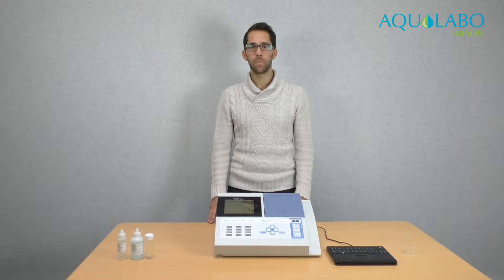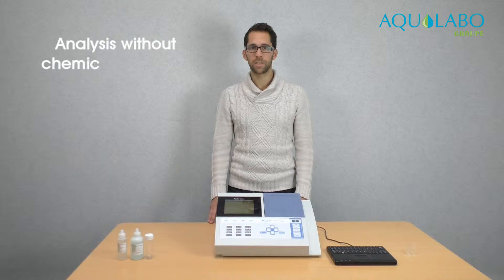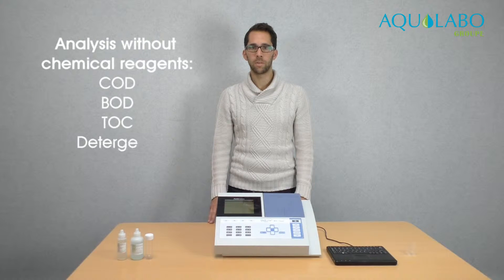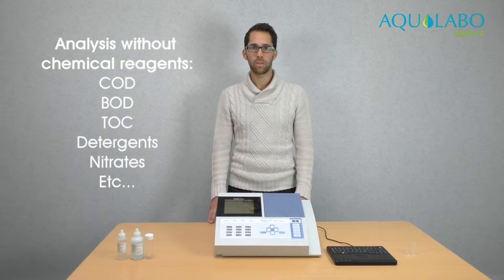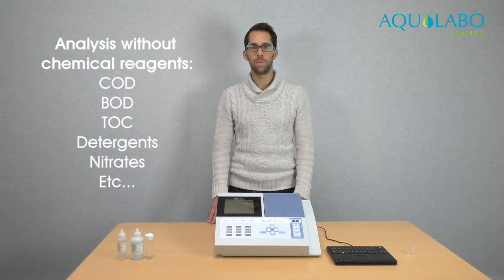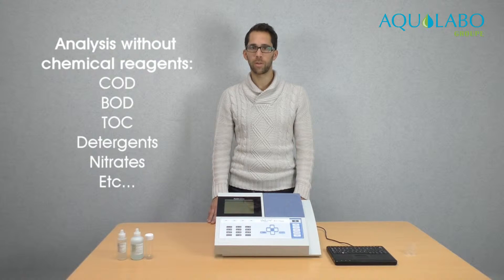It is also able to measure parameters such as COD, BOD, TOC, detergents, or nitrates, thanks to a UV method that doesn't require chemicals.